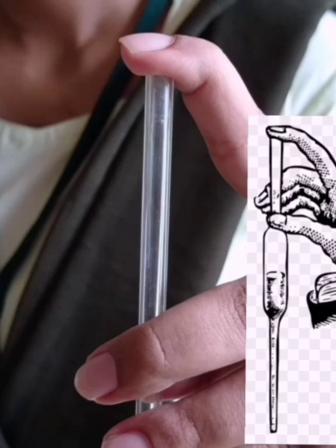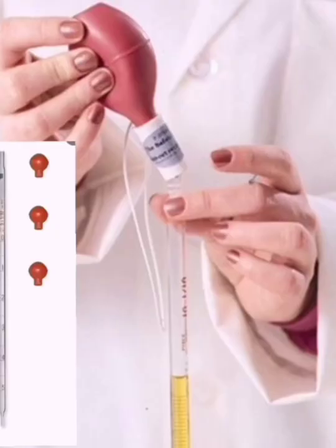Mouth pipetting is forbidden now, especially when using concentrated solutions. This is the most common method of becoming infected or poisoned in a chemical laboratory. So, rubber bulbs are used nowadays. It serves as a vacuum source for filling solution through a pipette.